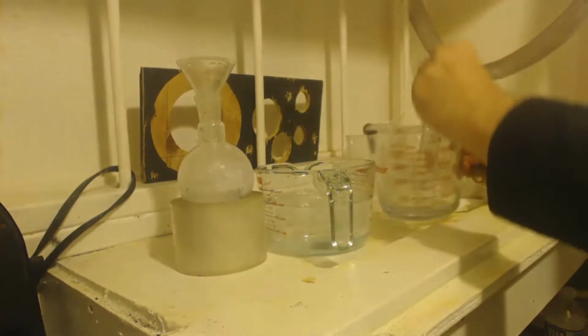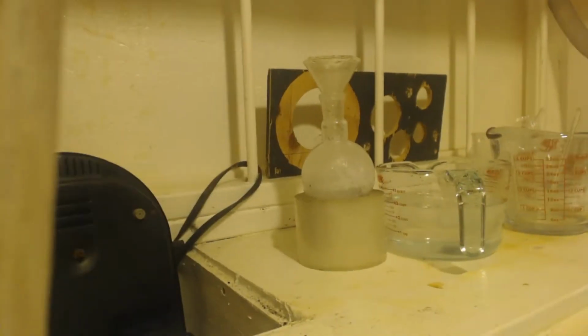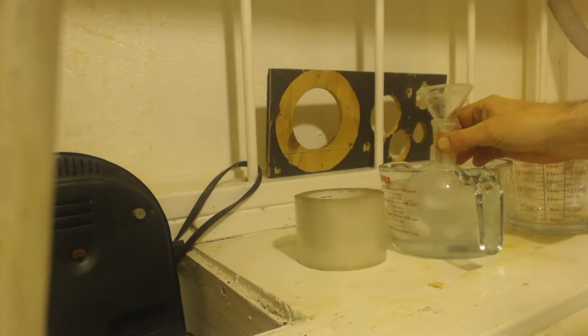Oh, crap. Look. Got the ice bath to cool it down.